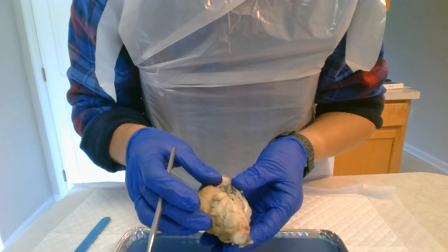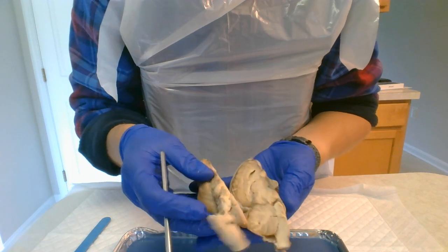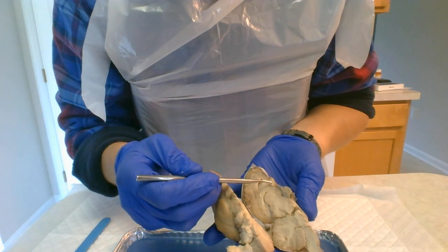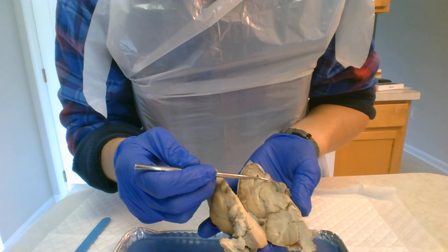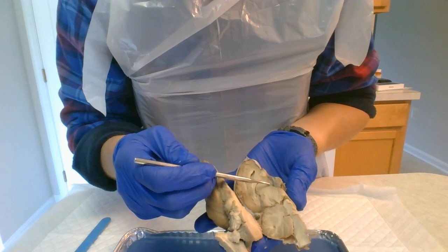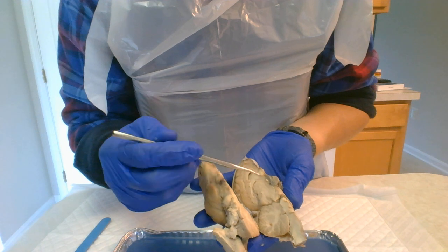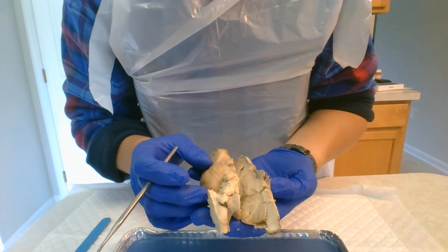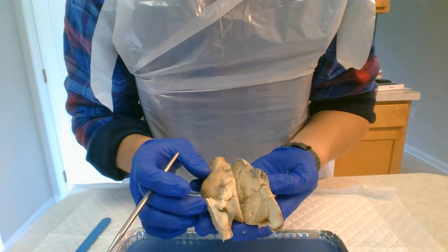Then you have the oculomotor nerve. Here is the optic chiasm and here is the oculomotor nerve. I can't see the trochlear nerve, the trigeminal nerve, or the abducens nerve.